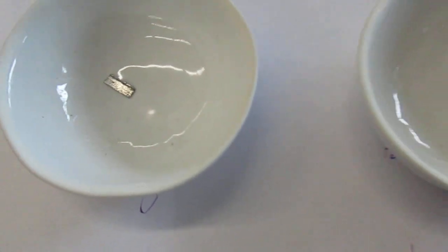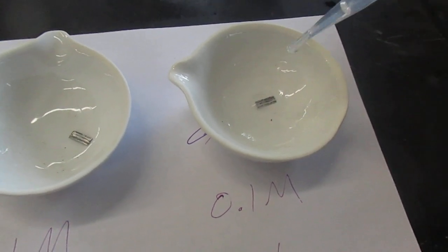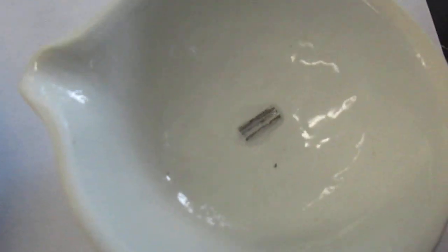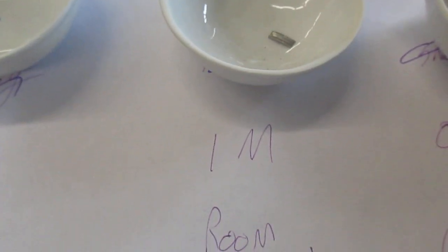I got one piece of magnesium, roughly the same size in each. Let's start with the 0.1, the 1 molar.